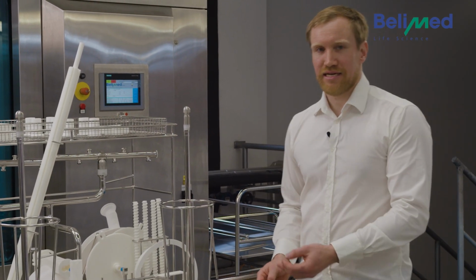As you can see, it's possible to make so many mistakes, and it's really hard to recognize them at all. Only an experienced worker can do such a process really reliably, but tiny mistakes can lead to big problems. So just imagine if this rack with all the mistakes I made had been washed, we couldn't promise a successful cleaning result. That's why we decided to develop something new to make the whole loading process safer.